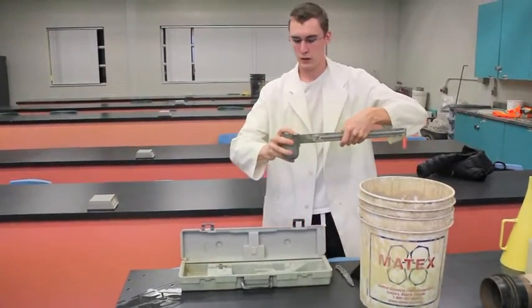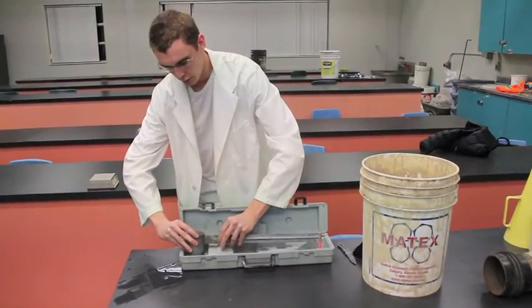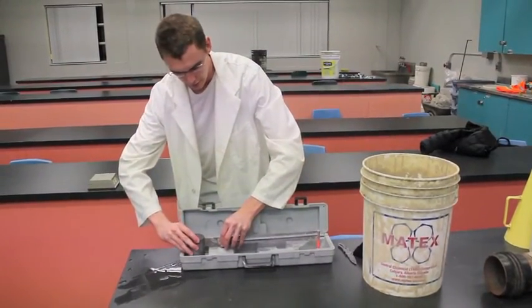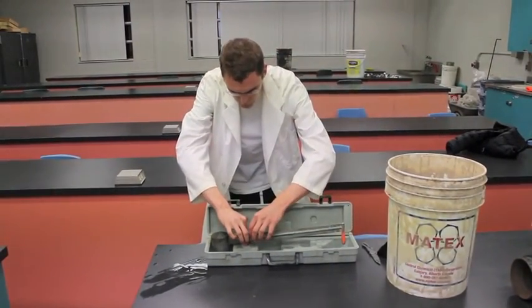So there we go, it's nice and clean. Now you're going to want to bring it back over to your kit. Pinch right here, the knife point, you're going to want to pinch it when you set it down. Continue to pinch and now we're going to measure it.